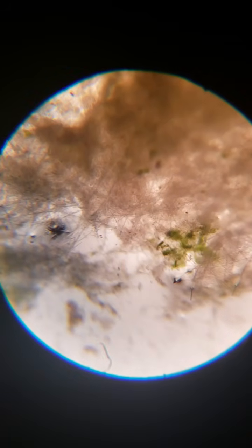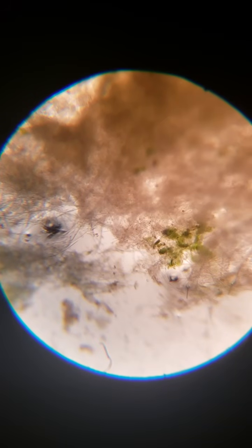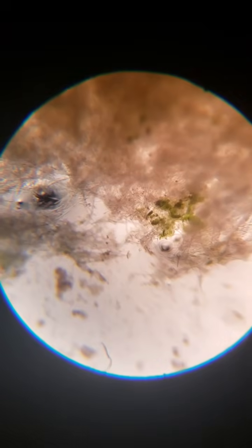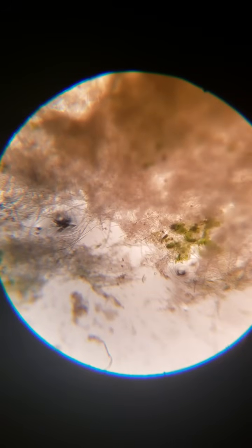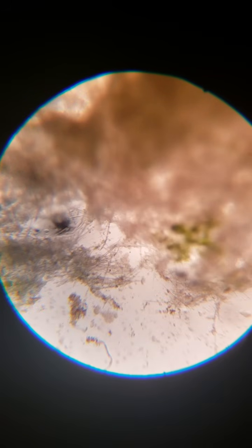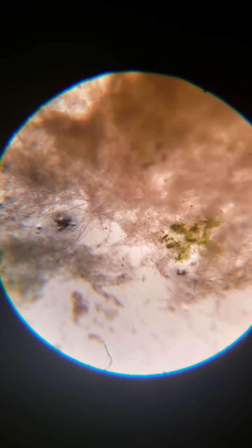And also, you can see that the diatomaceous algae, that green algae, that's green spot algae, it gets together and helps feed the sponge. They work in tandem and they share chemicals. One swaps sugar for proteins and other ions, like I think there's one that gives calcium and one that does zinc also.